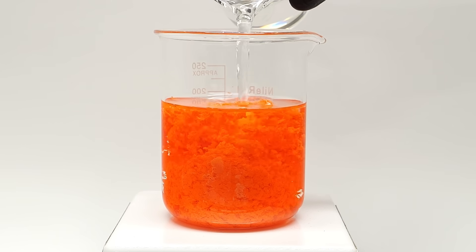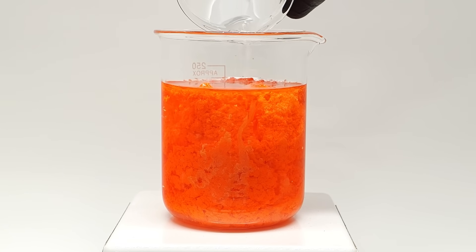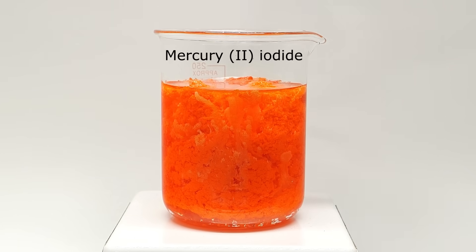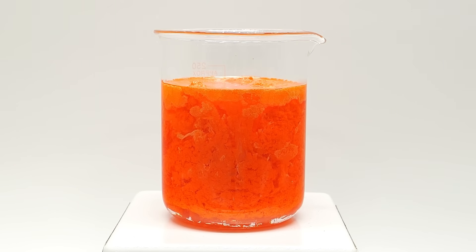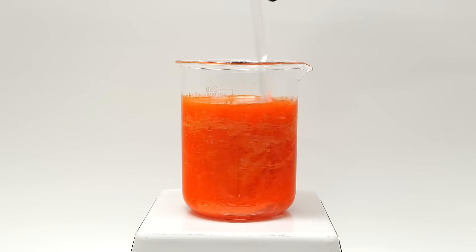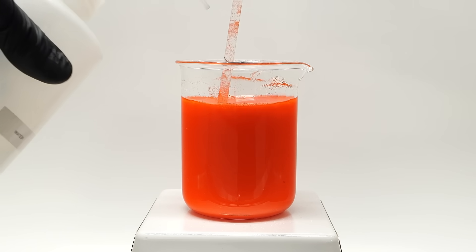This almost instantly reacted, and it was turning the mercury nitrate into mercury iodide, which wasn't soluble in water. When I was done adding it, I stirred it around, and then I let it sit there for a while.